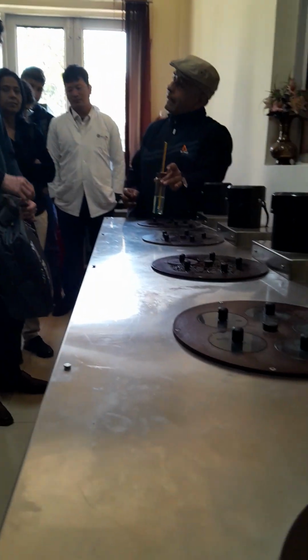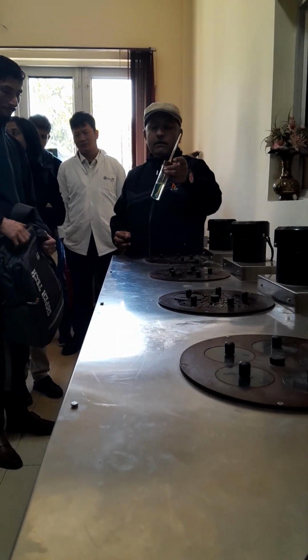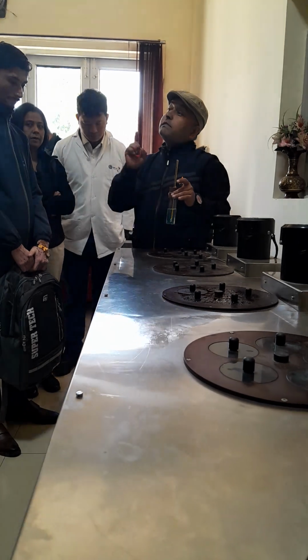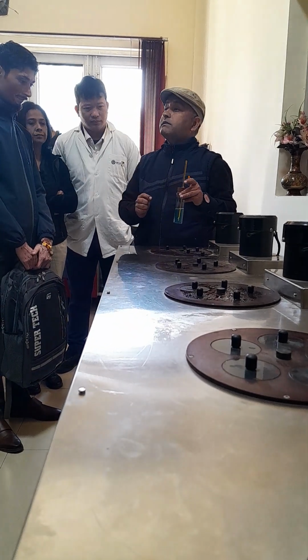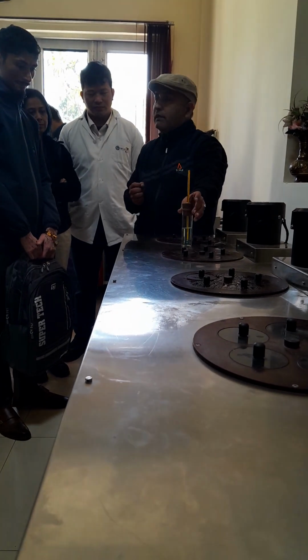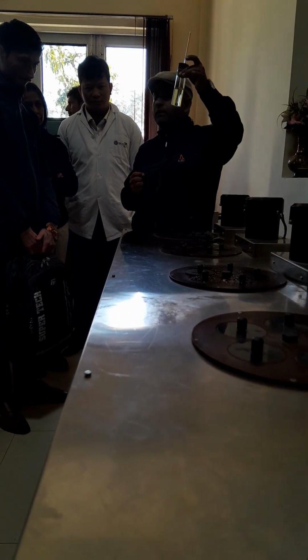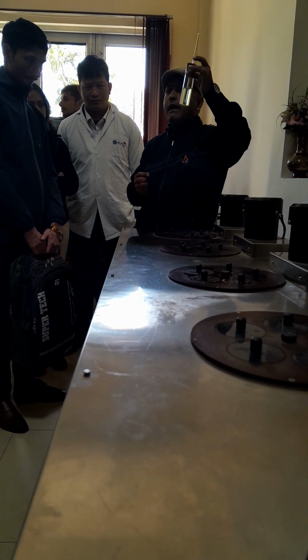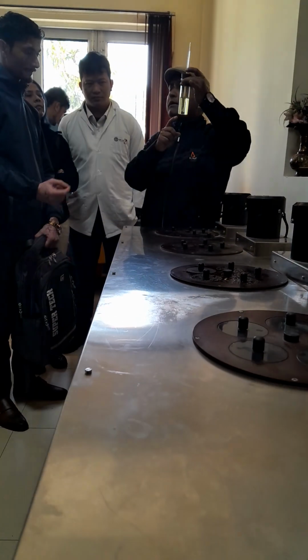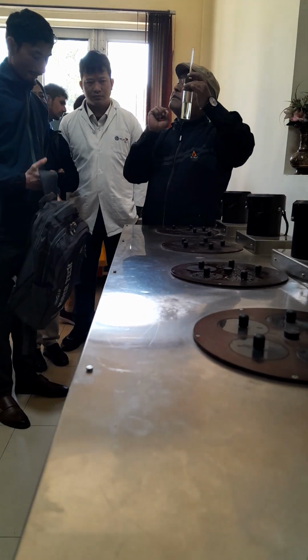So keep it again, then back, and just see and again. So only 3 seconds will it take. Otherwise there will be a disturbance of the wax crystals. So do not, when you are picking it up, keep it for 5 seconds or 1 minute. What will happen? There will be a disturbance in the wax crystals.